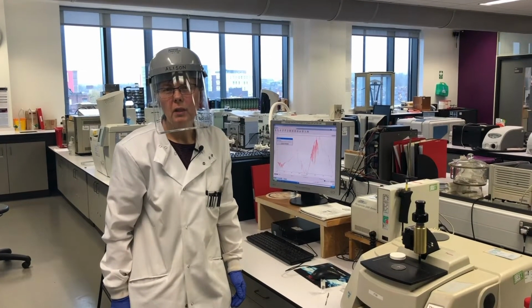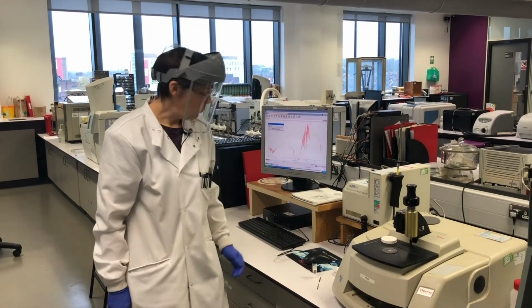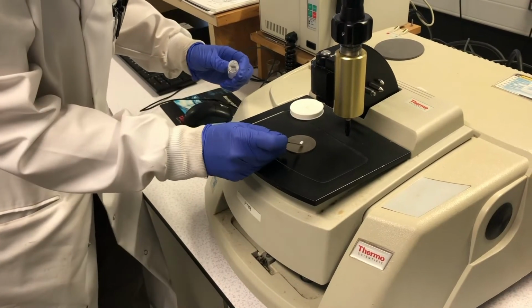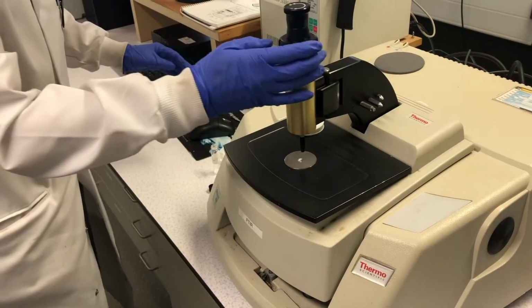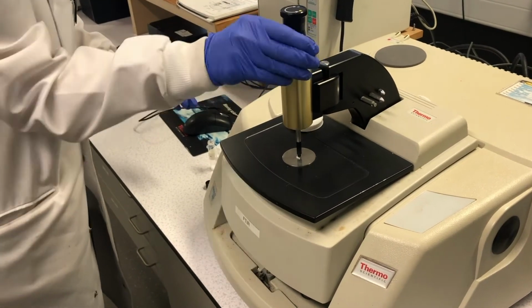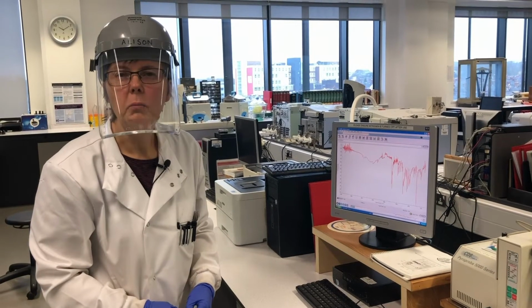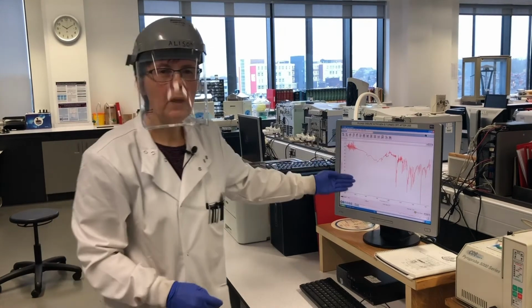Infrared spectroscopy is a really widely used technique in forensics labs across the country. We're going to use it on our white powder today to get a further identification of it. A small amount of powder is placed onto the diamond stage and pressed against the diamond attenuated total reflectance crystal. The infrared light energy really interacts with the covalent bonds in the molecules and produces a spectrum.